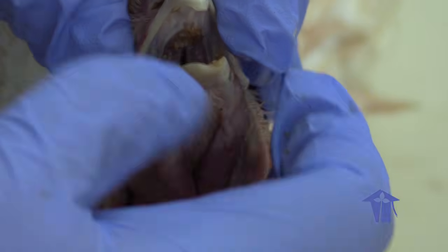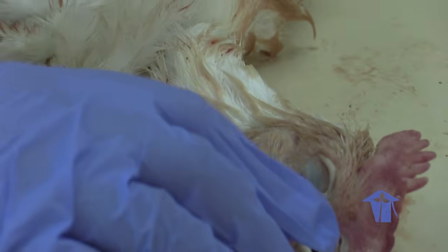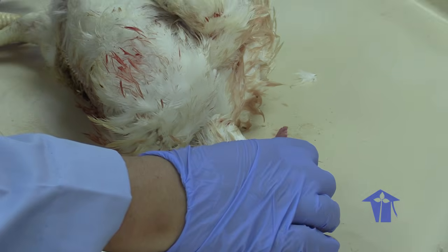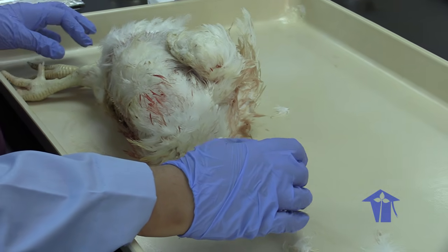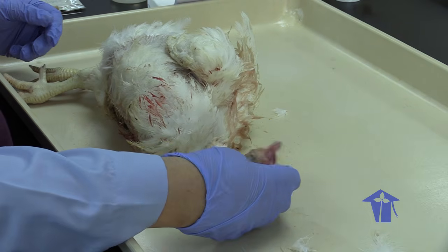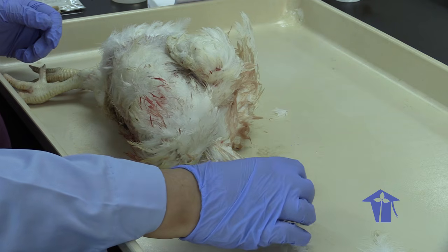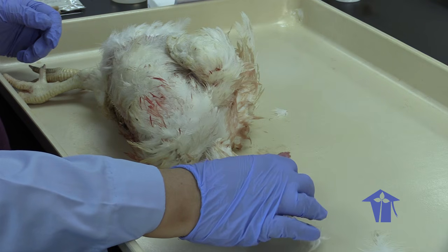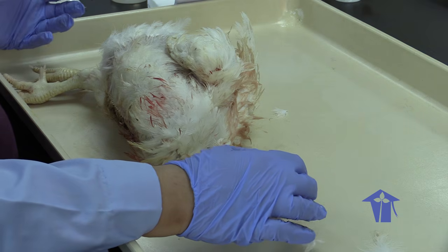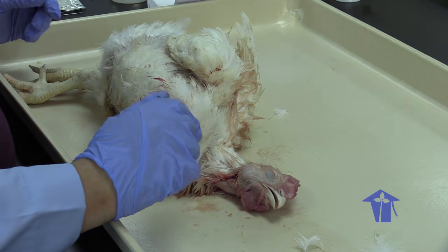This is because the chicken does not really keep a lot of food in its mouth for a long time. When you think about how we eat, we take a bite of food and then get it nice and wet with our saliva, chew it up, break it down into smaller pieces, get it into a nice tight bolus, and then we swallow. This guy's digestive system is basically geared towards getting as much food in as possible, right? So it's basically just going to stuff its gullet, literally. And we will see when we look at the upper digestive system of the chicken exactly what that means.